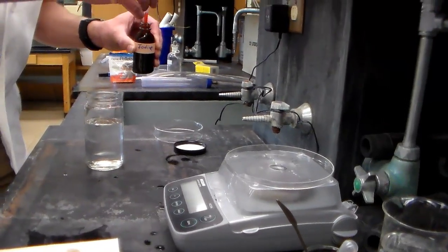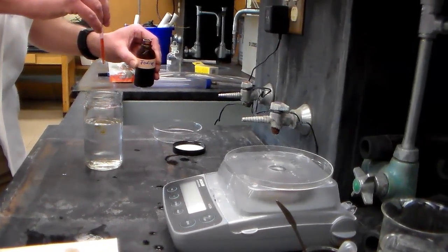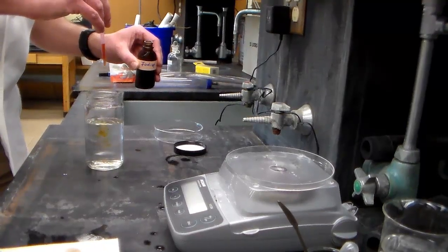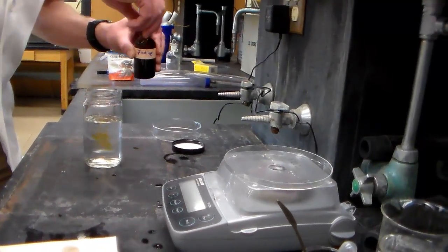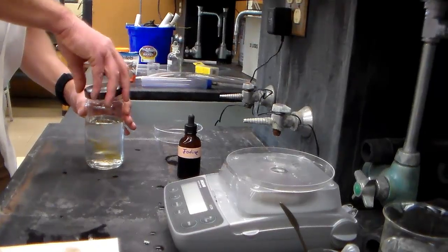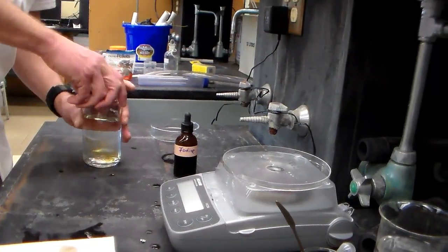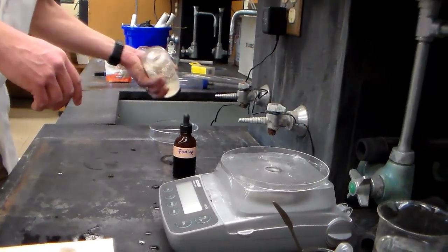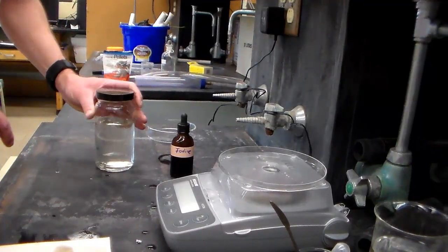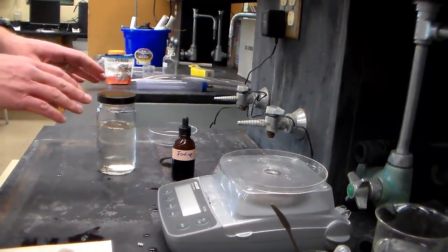...we just go one, two, three, four, five or so. And then you can put your lid on the jar, and over a sink, give it a little shake to mix it, and then wait a few minutes and look for a color change.